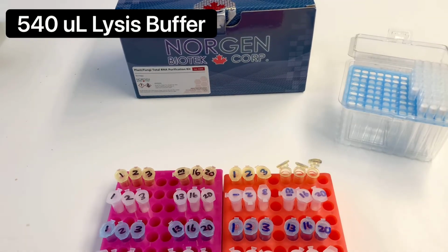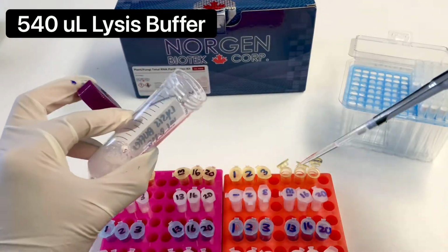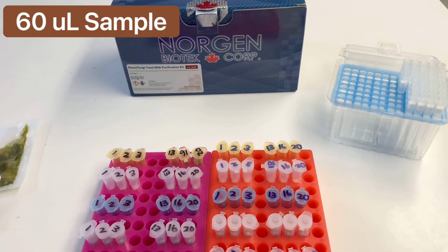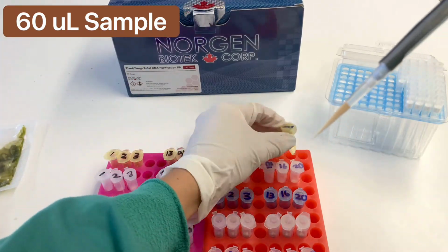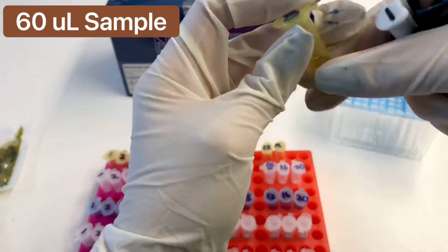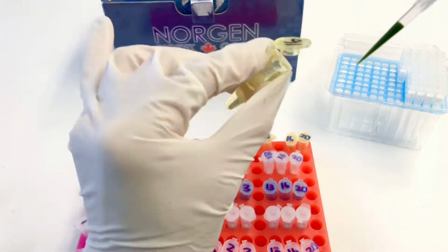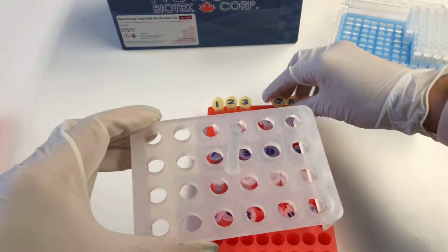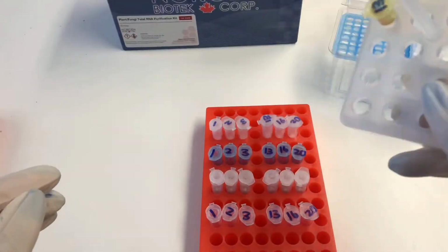Add 540 microliters of lysis buffer into some empty tubes. Next, add 60 microliters of the sample. Be sure to remove the sample from the back of the mesh to avoid debris. The lysis buffer will help open the plant cells, which will release the plant virus. Gently flick the tubes to mix. Place the tubes on a tube rack. Invert to mix.